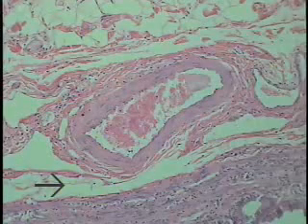Having completed an examination of a muscular or distributing type of artery, go then to the wall of an organ and look for small arteries of different sizes and calibers to see what these small arteries look like. They are small arteries because one rule of thumb could be that they're not isolated and they're within the wall of an organ.